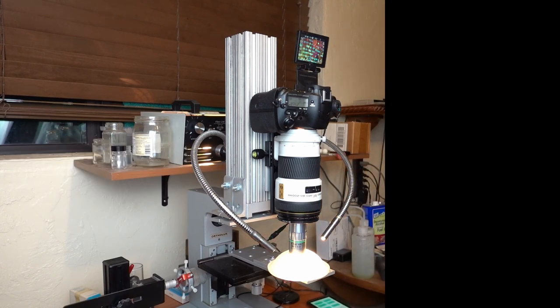Now we'll start the process. So I hit run. It waits settling time, takes the picture. Then the motor moves, takes another picture, motor moves. So we're moving, that rotation corresponds to one and a half microns. You can see it'll take a long time to stack through these pictures. Not only do you have the depth of the stuff you're taking the pictures of to stack through, you also have any tilt. So it can take half an hour, 40 minutes. So the best thing to do is just go have coffee, watch YouTube videos or something, come back, and when it's done, take the images to the computer and get Zerene Stacker working on them.